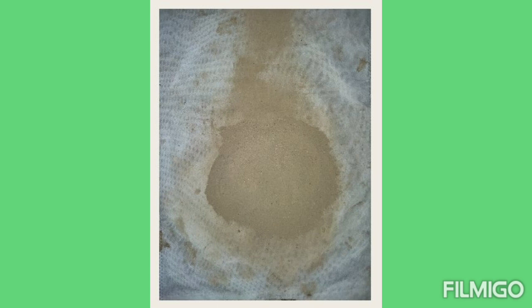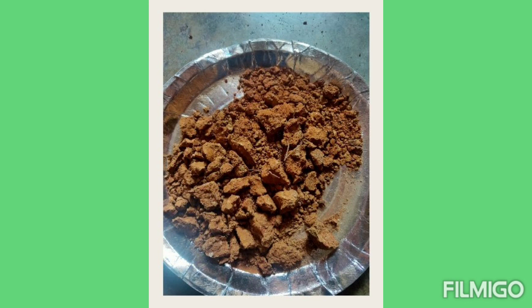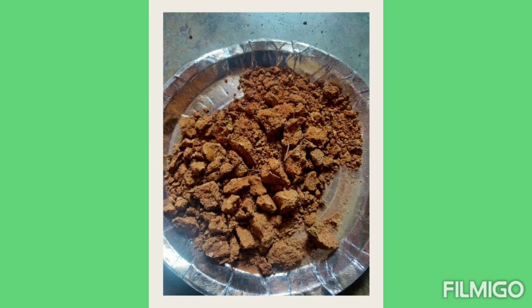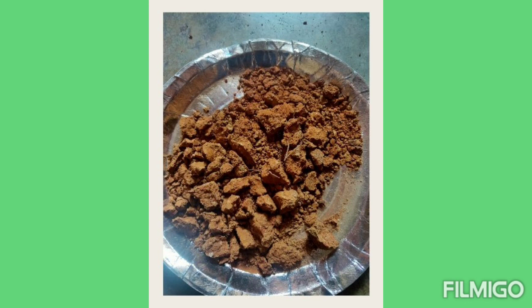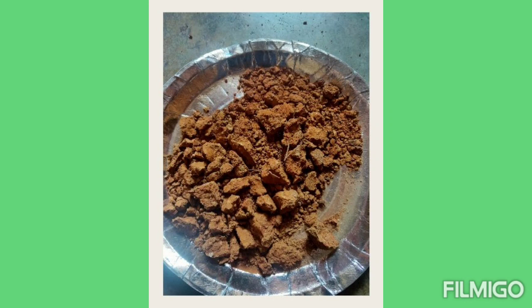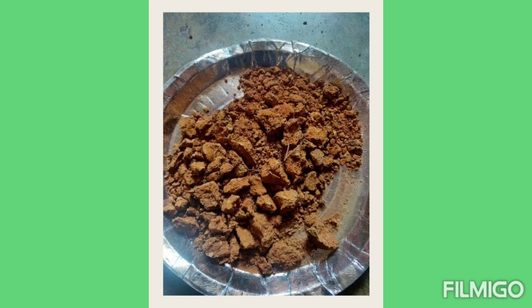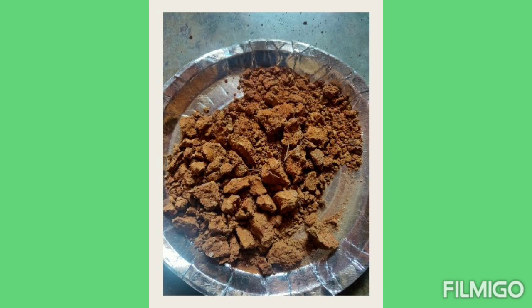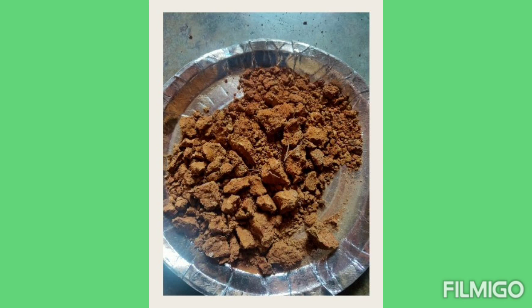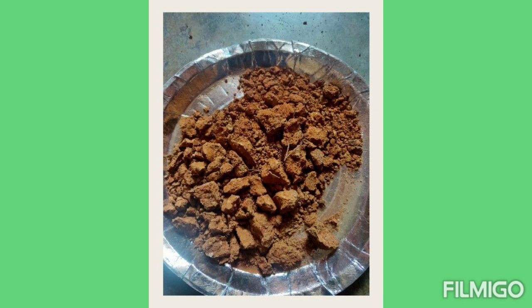Now see — here I am taking another soil sample from another place. You can see that it is red in color. We also make it dry and crush it to make it into powdery form.